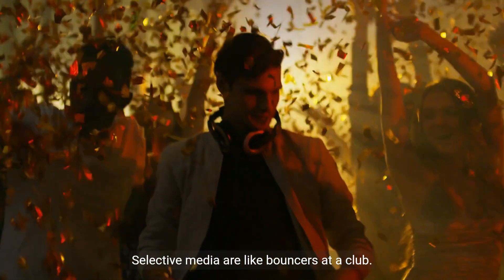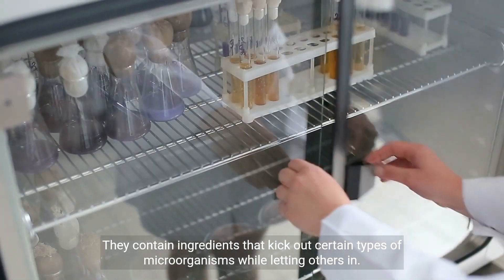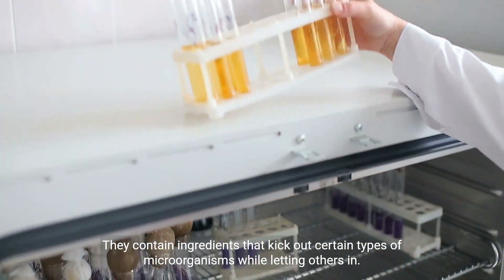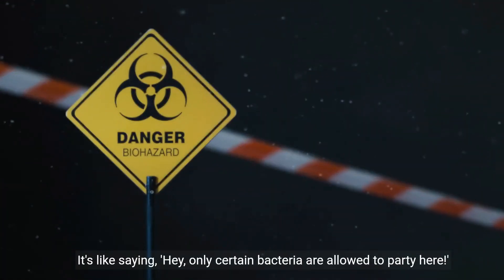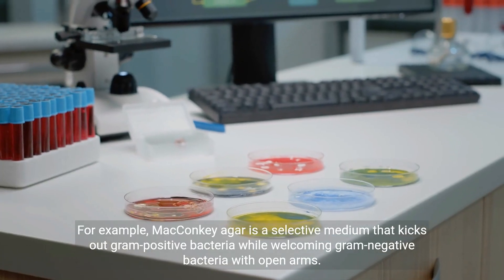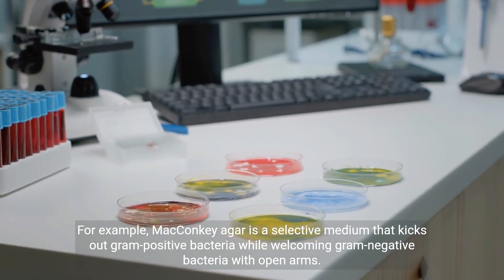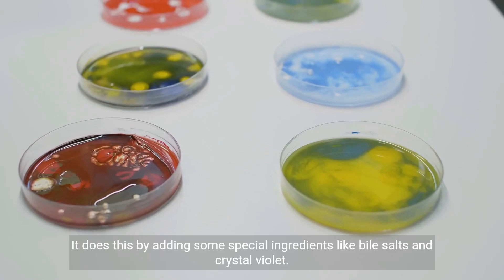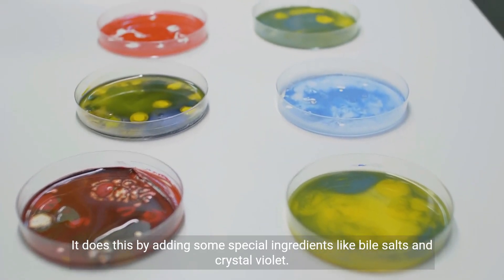Selective media are like bouncers at a club. They contain ingredients that kick out certain types of microorganisms while letting others in — only certain bacteria are allowed to grow. For example, MacConkey agar is a selective medium that kicks out gram-positive bacteria while welcoming gram-negative bacteria, by adding special ingredients like bile salts and crystal violet.